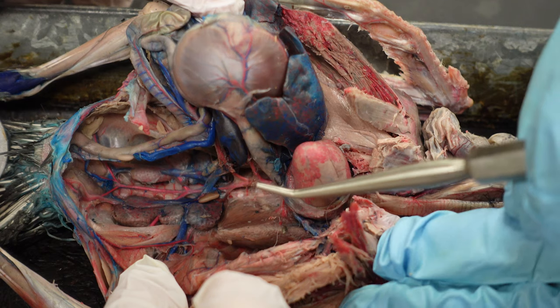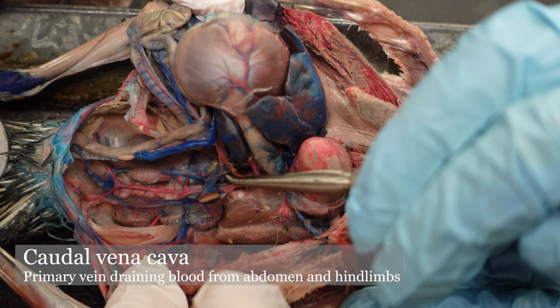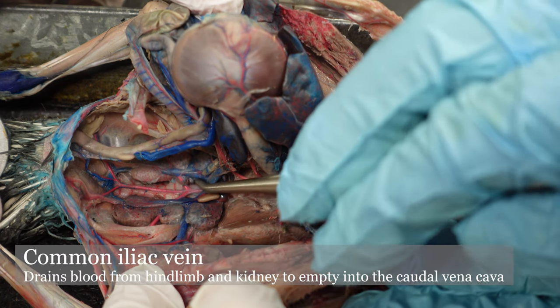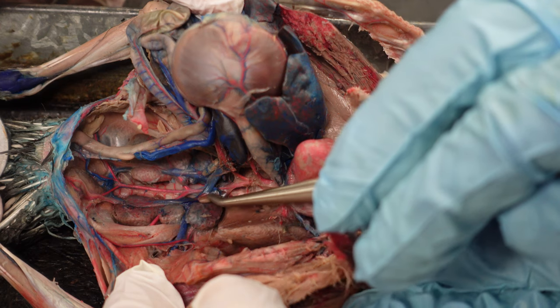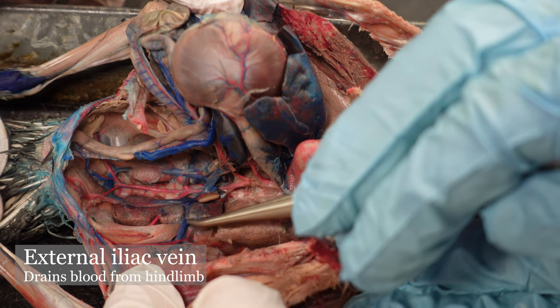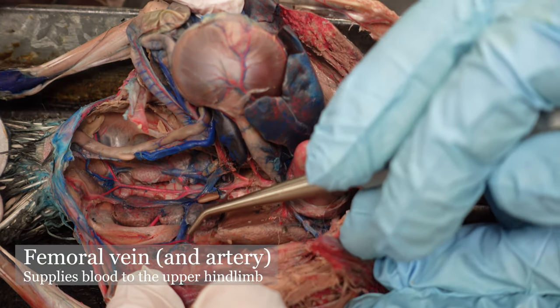Now let's go over the veins of the abdominal region of the pigeon. This major vein is the caudal vena cava, or posterior vena cava. That caudal vena cava splits into common iliac veins that go down either side. That common iliac vein will then split once again into an external iliac vein that goes out toward the leg. Once it passes through that abdominal wall, just like the artery, it becomes the femoral vein.